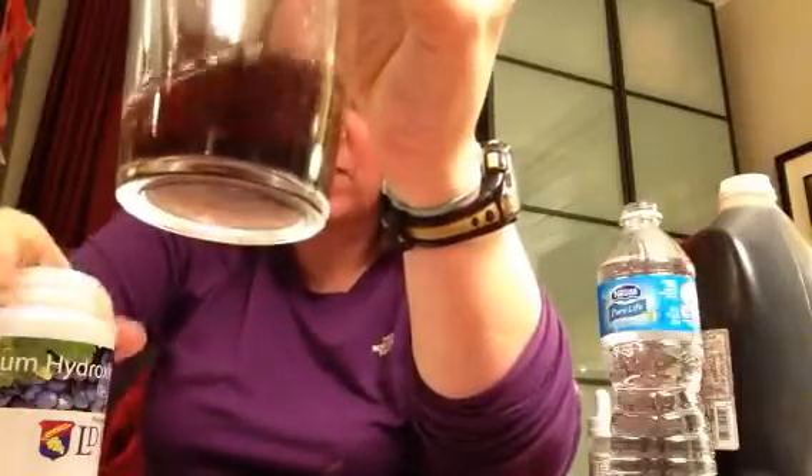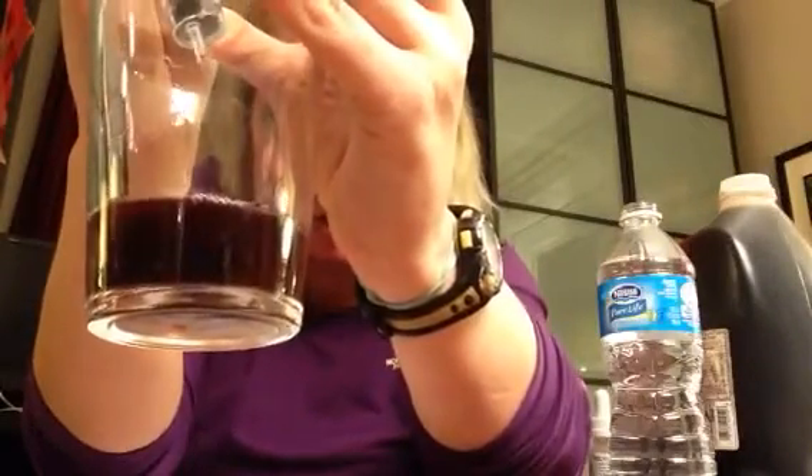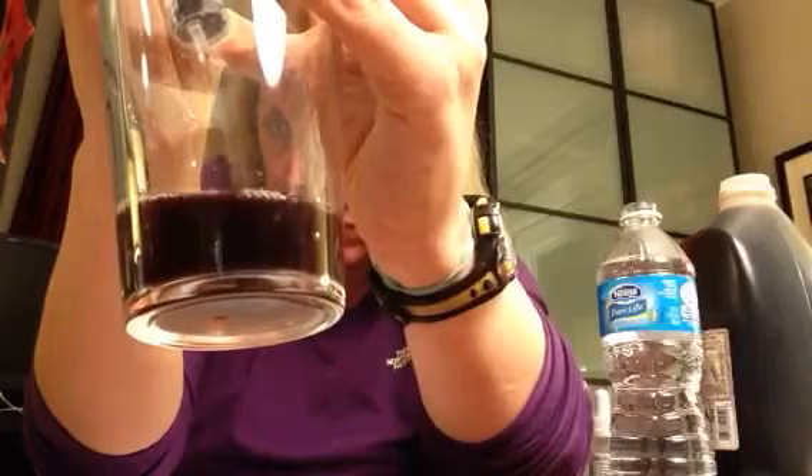You can sometimes also use a white background just to kind of see where it is, if that's helpful. I feel like we're close. That may have done it. Right now I only have one CC left — I'm going to do just a little more to make sure that it really did it. I think it was one CC left when the color change actually happened.